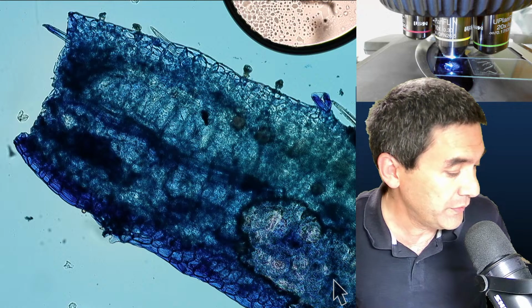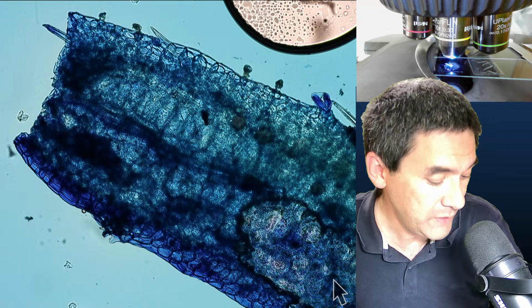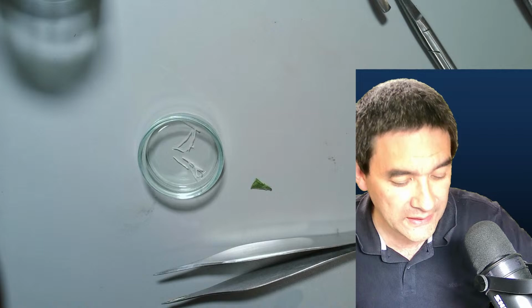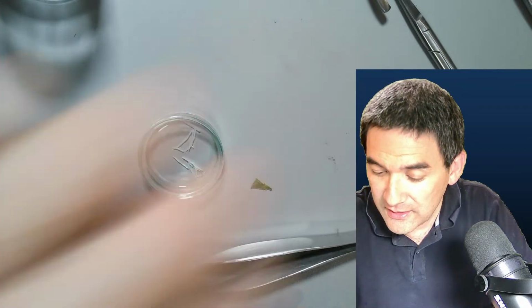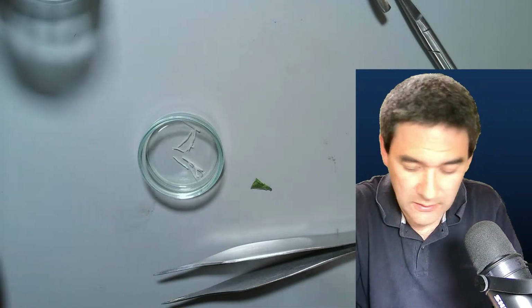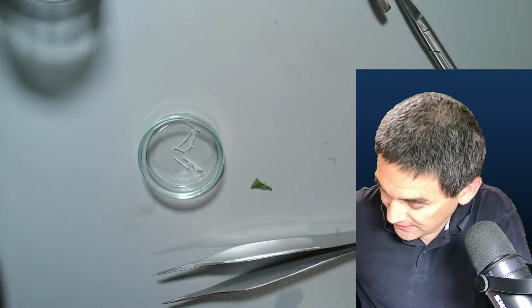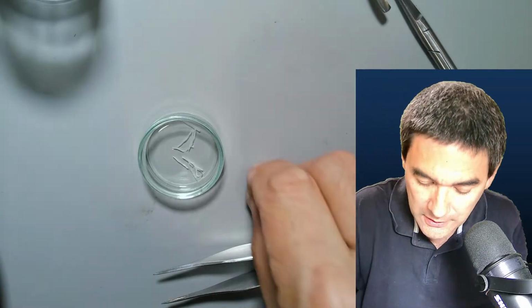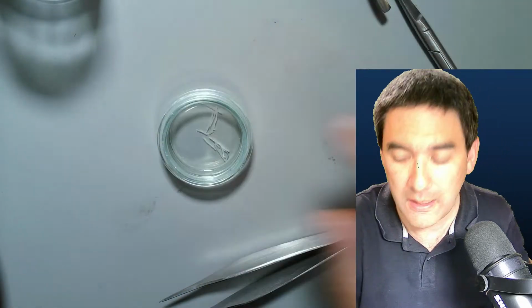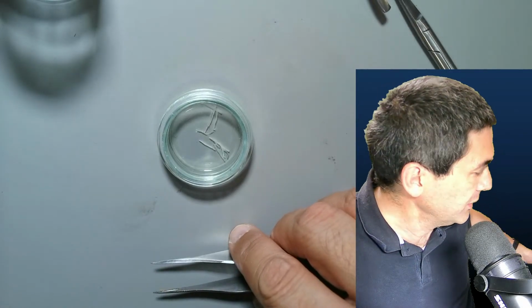I want to show you now the adapter that I have. I know that this is a very common issue. I need to clean up the desk a little bit. So many people want to know about connecting cameras to microscopes, and honestly, there is no simple, easy way, unfortunately. However, there are several techniques, and this is a new one that I just want to present, which I did not make a video about yet, but a separate video will be made. I just want to share it with you. Even if you already have a camera connected, it may still be interesting to you, so that you know what's out there.